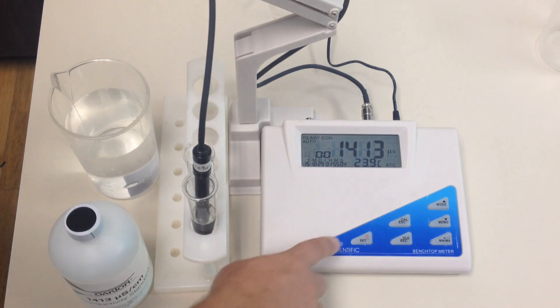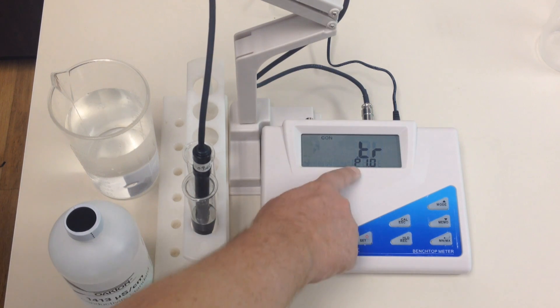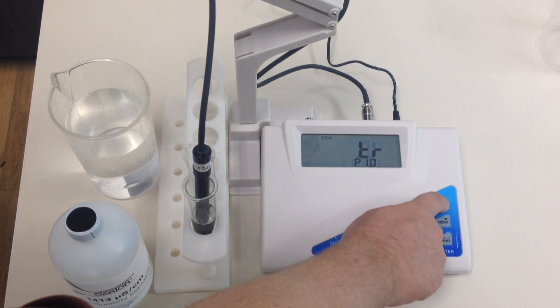So the first thing you want to do is make sure the unit is on, it's in the setting that you want, and you hold the set button until you see the P in the subset. So now I'm in the actual function button of the computer, or the little computer that's inside this unit. I'm going to go to P9, which is reset.